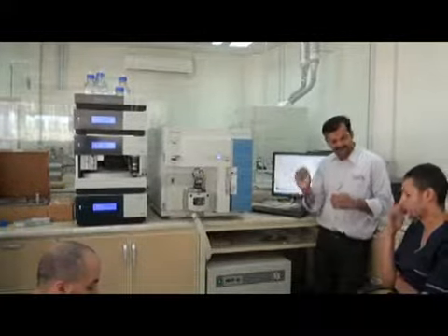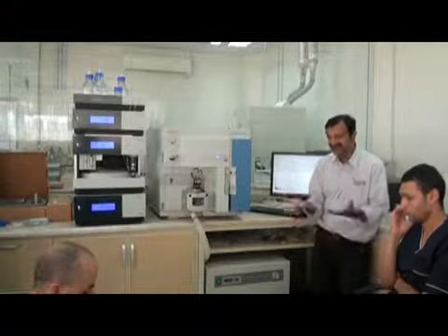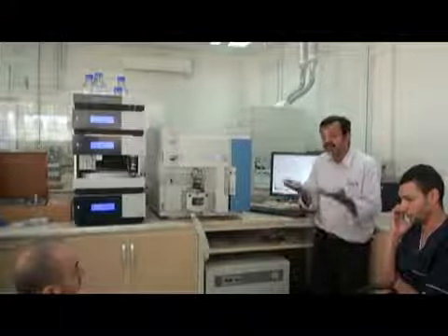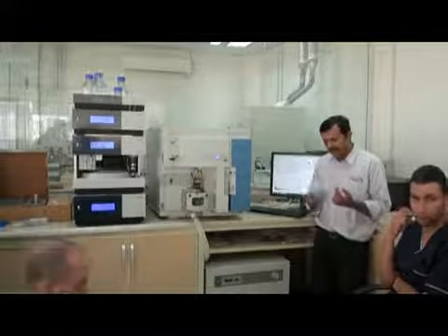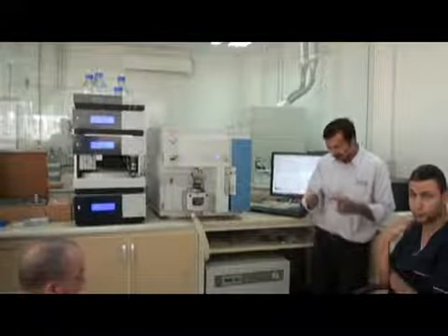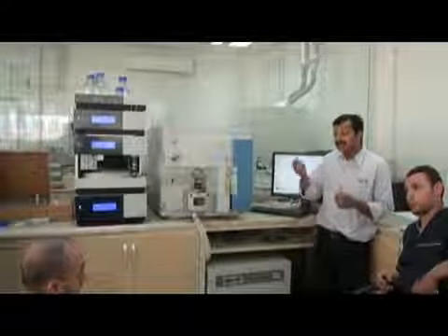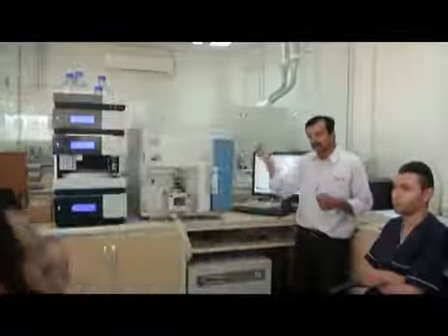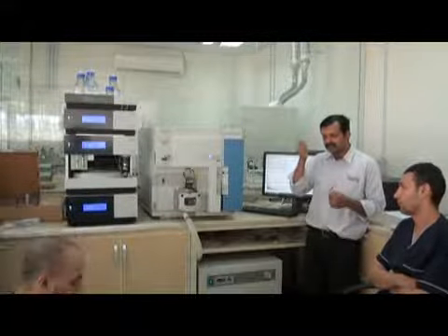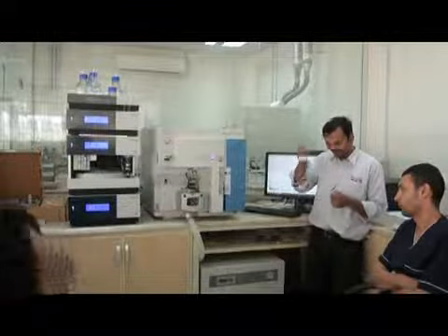The electronics should be off. This is the startup of the instrument. I am telling you how to start the instrument. So electronics off. Vacuum on, electronics off. Now you switch on the main power. There is a main circuit breaker here. Main power to on. Not the electronics, not now. Just main power on.